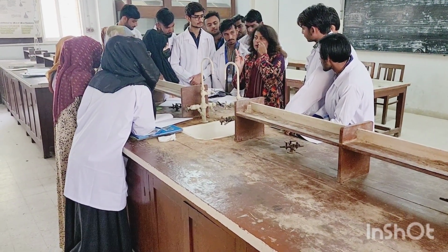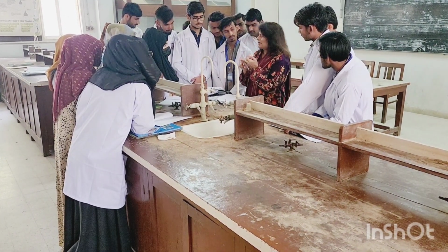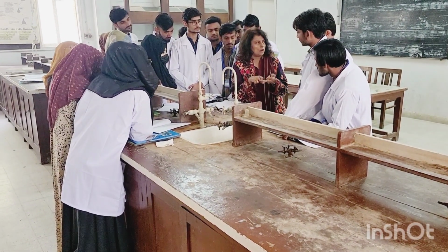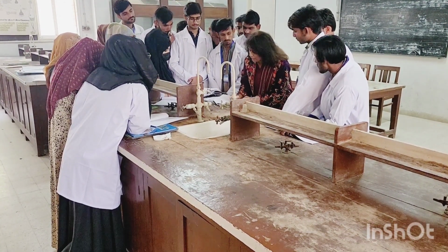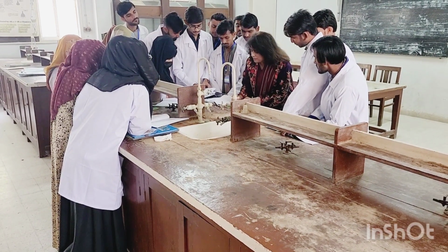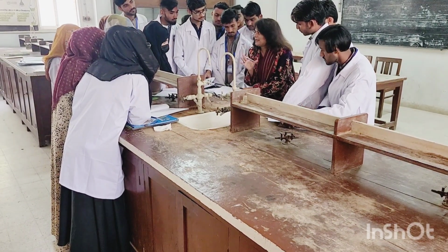If my compound got dissolved in ethyl alcohol, or in chloroform, or in methyl alcohol, or in benzene, or hexane, these are all the names. So you are going to try all these, and you will also try, in the end, an acid.